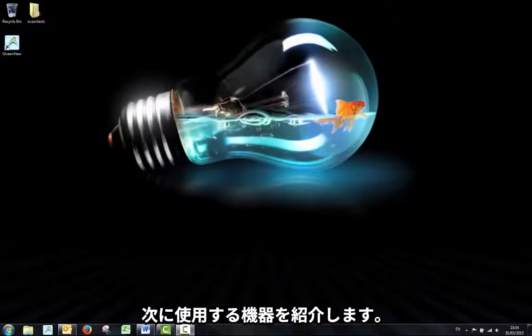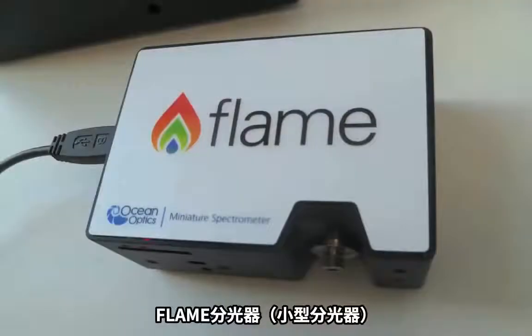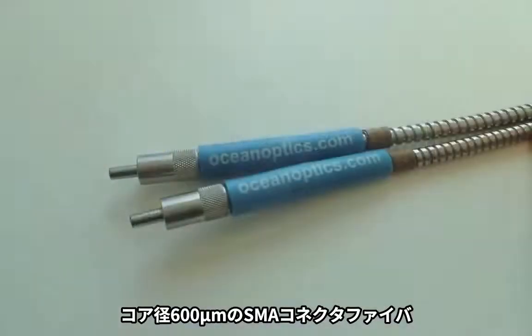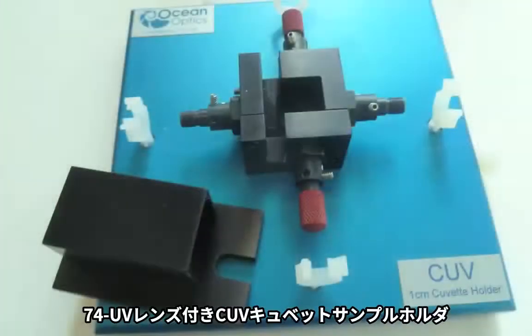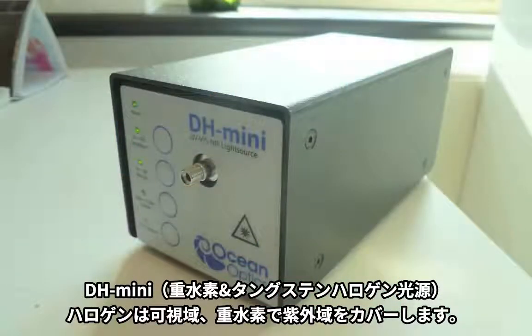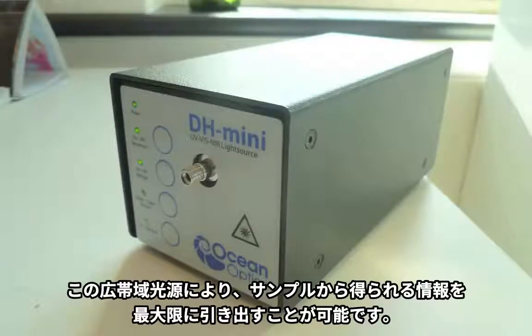The equipment used is as follows. The Flame spectrometer configured for UV-Vis, two 600 micron UV-Vis patch cords with SMA connectors, a CUV cuvette sample holder with two 74-UV lenses positioned opposite to each other, the DH-Mini light source which contains a halogen lamp emitting in the visible range and a deuterium lamp which emits in the UV. This broadband light source will maximize the information we can get from our sample by covering the regions where the sample absorbs most.